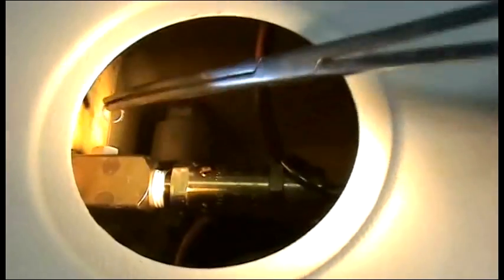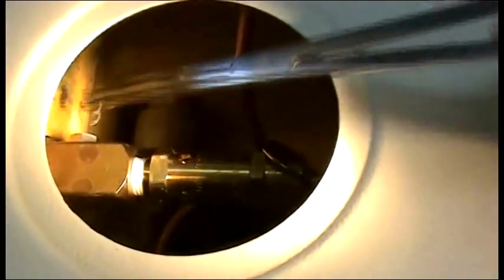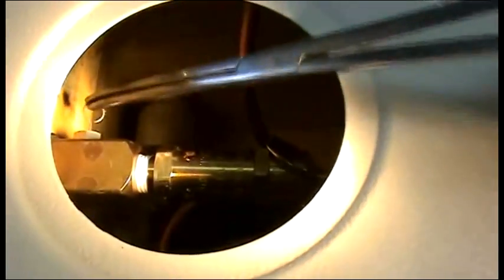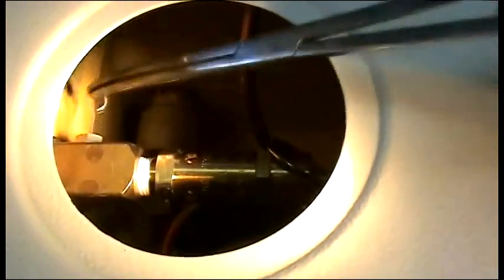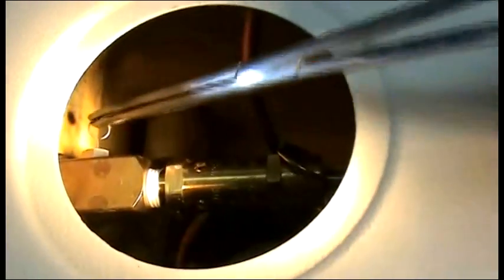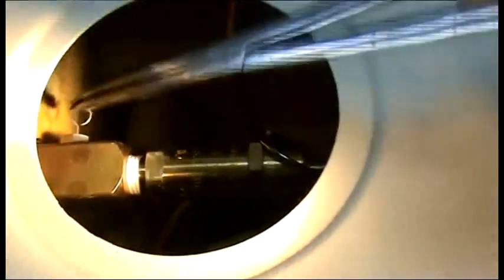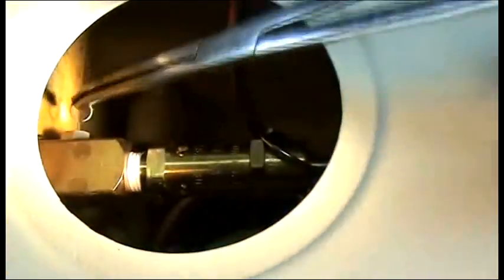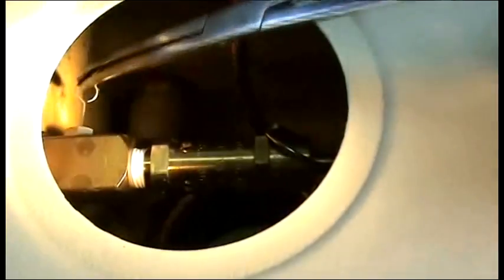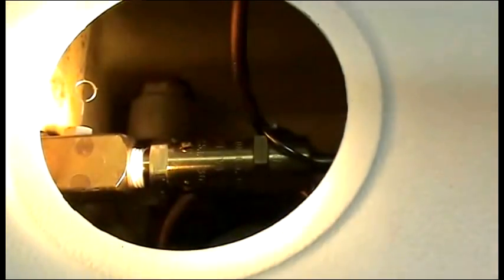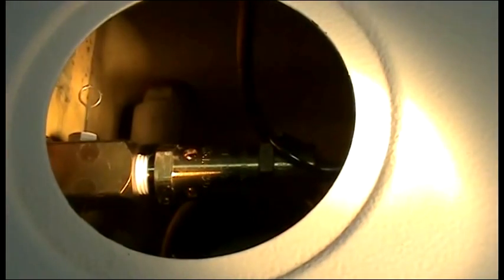While the unit is under pressure, this is great to do during a cleaning cycle when you have at least 25 pounds of pressure. You can do it without pressure, but this guarantees that any debris is blown out. The book might say do it ten times; I do it a little bit more. That will ensure that you release any air trapped inside the chamber. We need 100% steam.